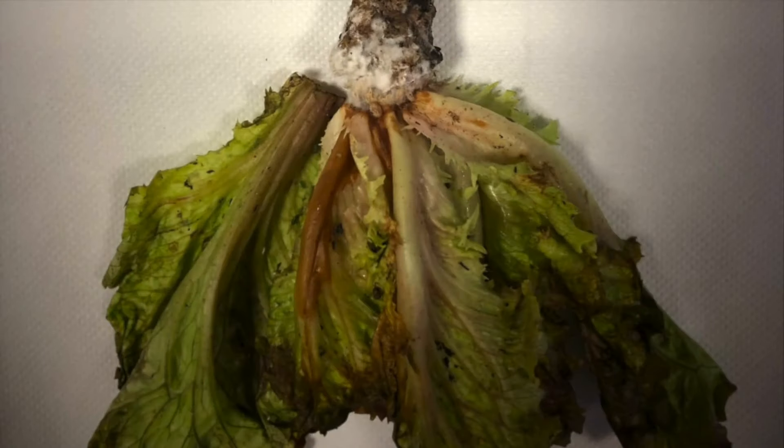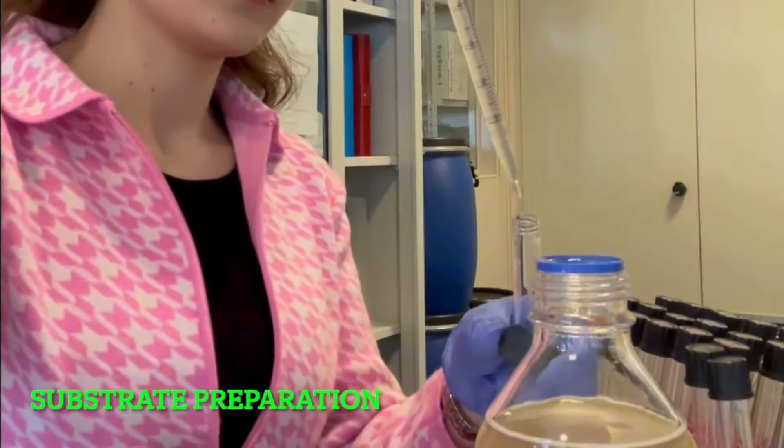We removed a small symptomatic piece from the lettuce, and after isolation we must conserve our Sclerotinia isolates.